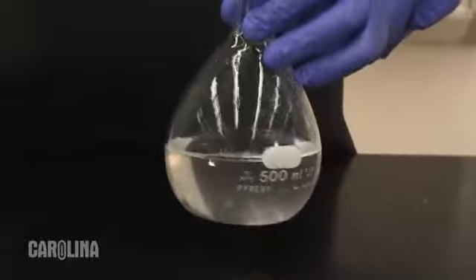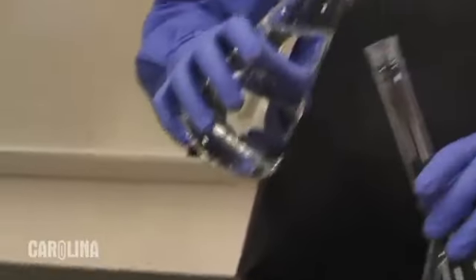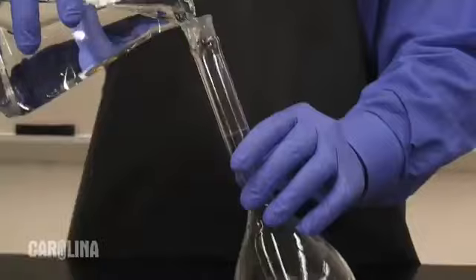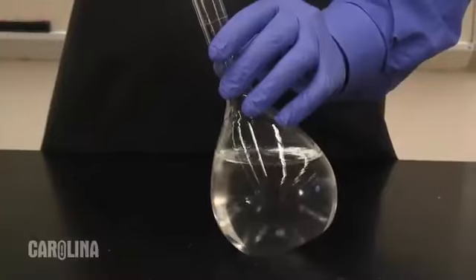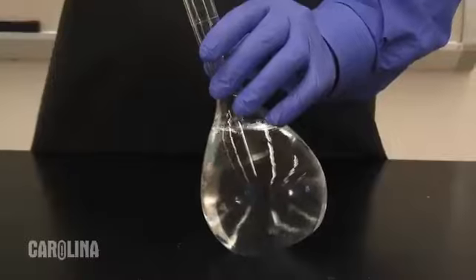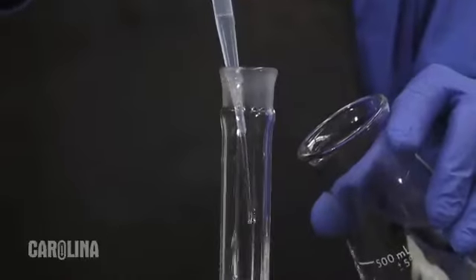Again, it's critical that all of the solute is dissolved prior to filling to the appropriate volume, as different solutes may take up more volume in solution than their undissolved salts. Now that the sodium chloride is completely dissolved, we can fill the rest of the bulb area and some of the neck with water. You should now carefully and slowly add water, our solvent, as it begins to fill the neck. Once you approach the etched or printed line on the neck of the flask, you should add solvent dropwise, monitoring the location of the meniscus.